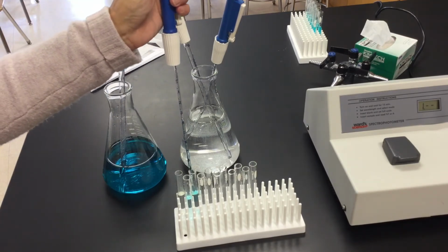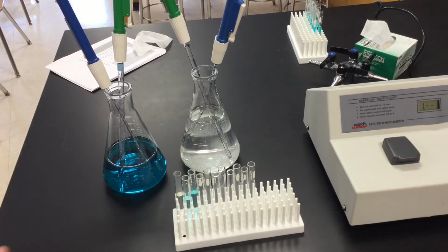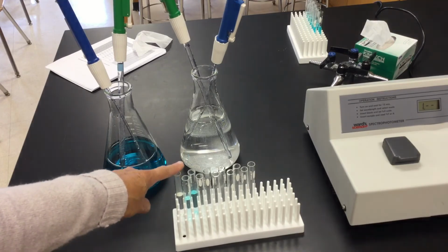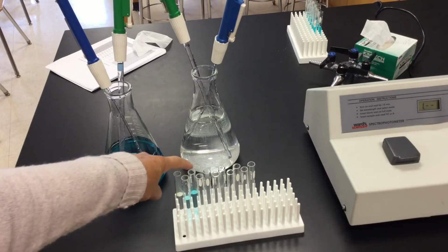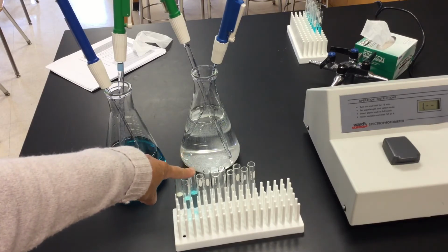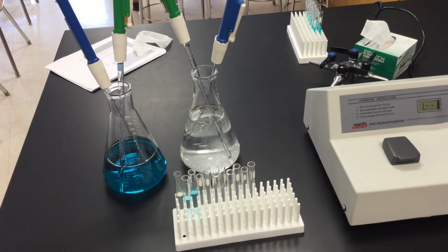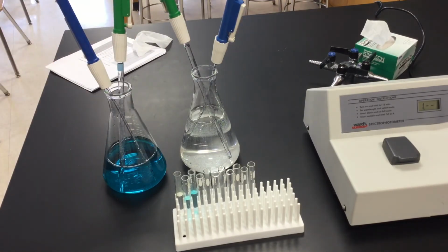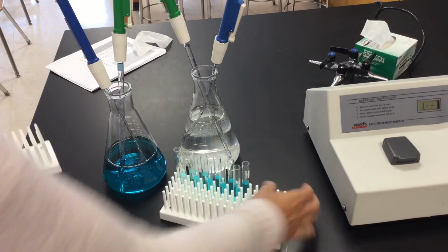So far I have 3 tubes. They should all have 5 milliliters within them. That is also a constant. You're going to notice the tubes start out clear, 5 mLs of water, pretty dilute, then 4.5 mLs of water and 0.5 ml of copper sulfate, then 4 and 1 of water and copper sulfate. You're going to keep going until that very last tube has just 5 mLs of copper sulfate in it. I'm going to do what the little cooking shows do, where they take one recipe away and go, oh look, here they are completed.